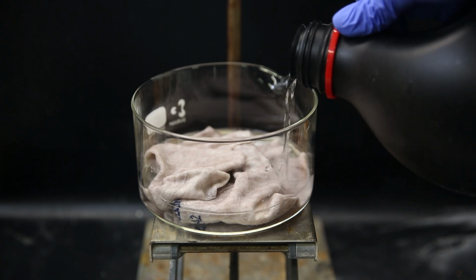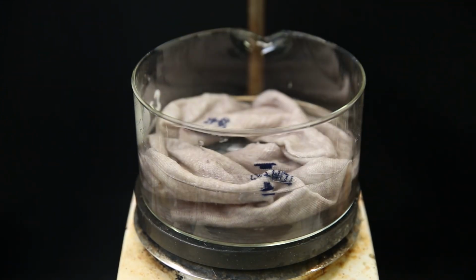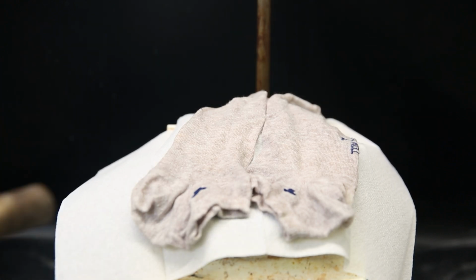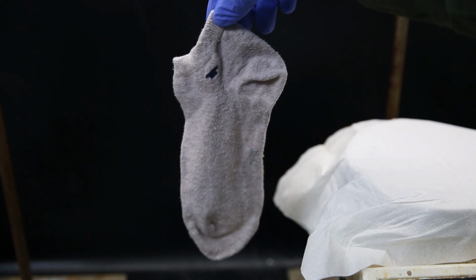I then tried to bleach it with some 10% hydrogen peroxide, but that stuff isn't working either. So I tried adding some more 50% peroxide, but I couldn't see if it was doing anything. I then tried to heat it, but that didn't seem to do much either. And afterward, I just put them on a hot plate to dry, and blasted with a heat gun to make it go faster. But it started smoking a bit too much, so I think I burned it, and there's also a hole. After a while, it is dry enough, and I guess I have a wider pair of socks now.